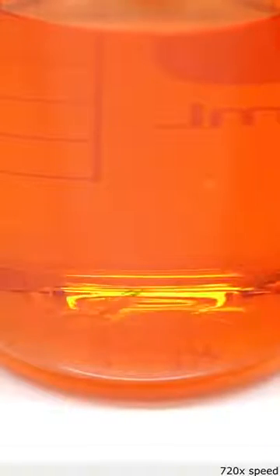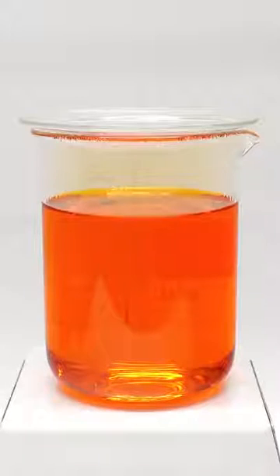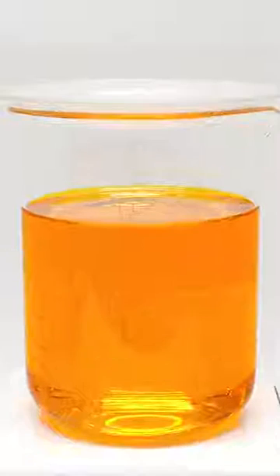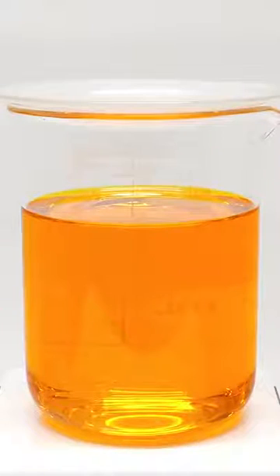I then kept occasionally adding acid, and over the next few hours, it slowly disintegrated. Then eventually, it completely disappeared. What I was left with was a nice red liquid, which turned orange after it cooled down. There was also no trace of the gold bar, and it's almost like it never existed.